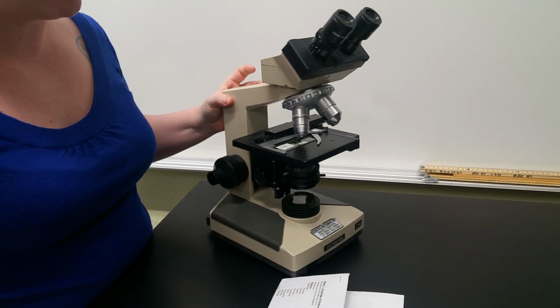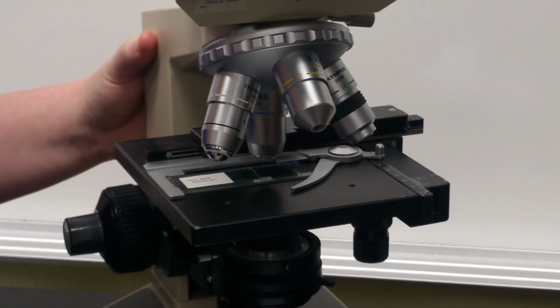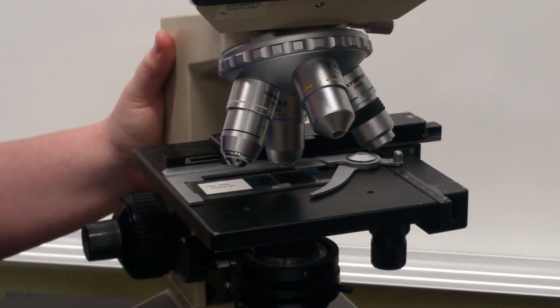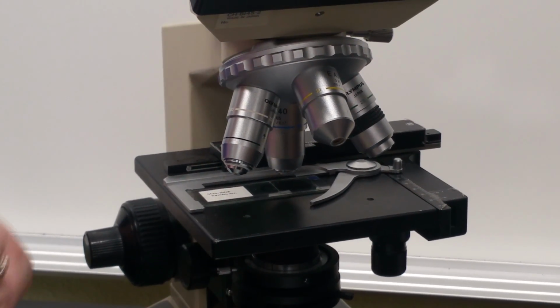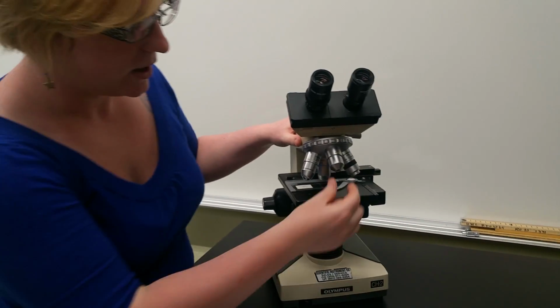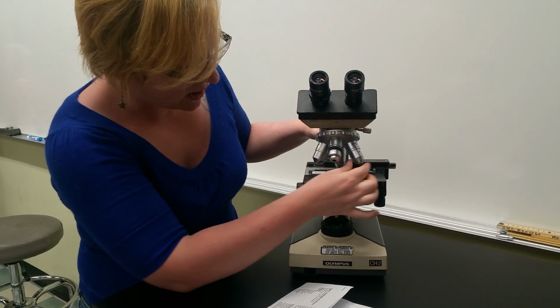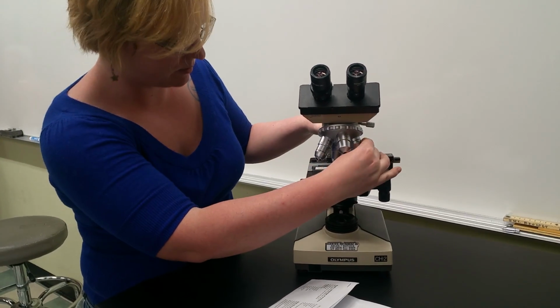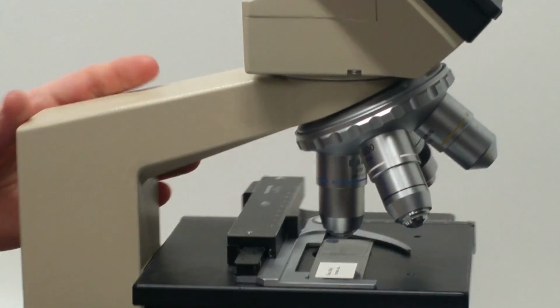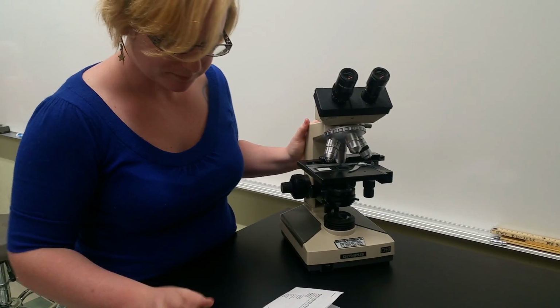Okay, next we have our objectives. So our objectives have different powers or different focus magnification powers. So you can zoom in really small, like to the smallest thing, or you can have kind of more of a coarse view of things and see the overall shape. So you have a less powerful objective here in the yellow and a more powerful in the blue. And you can see in this particular slide, we're on a high objective here. So we want to be able to have more detailed focus.